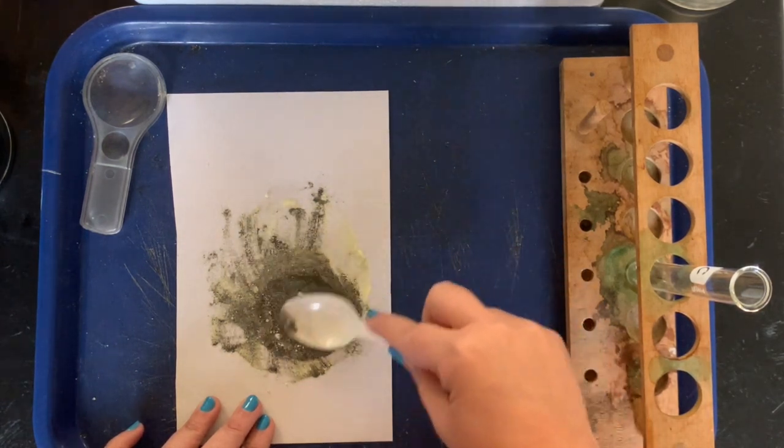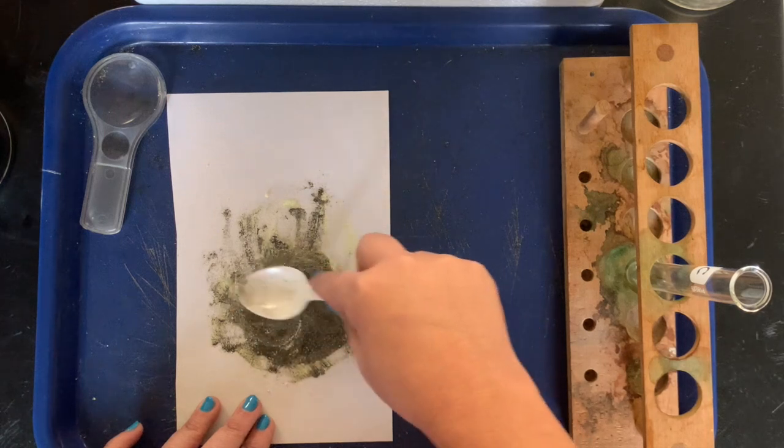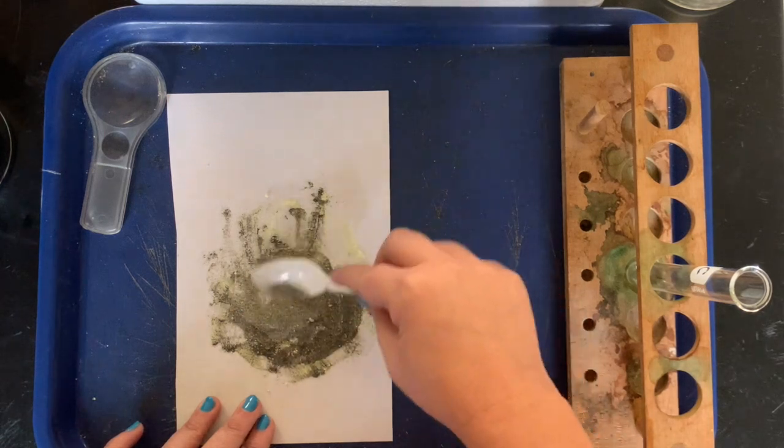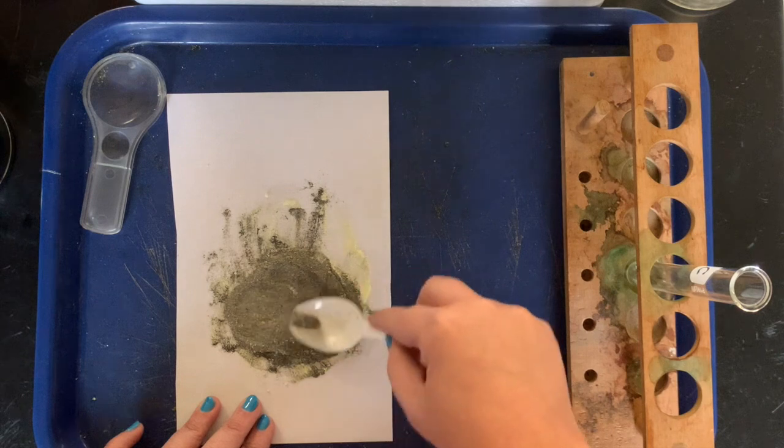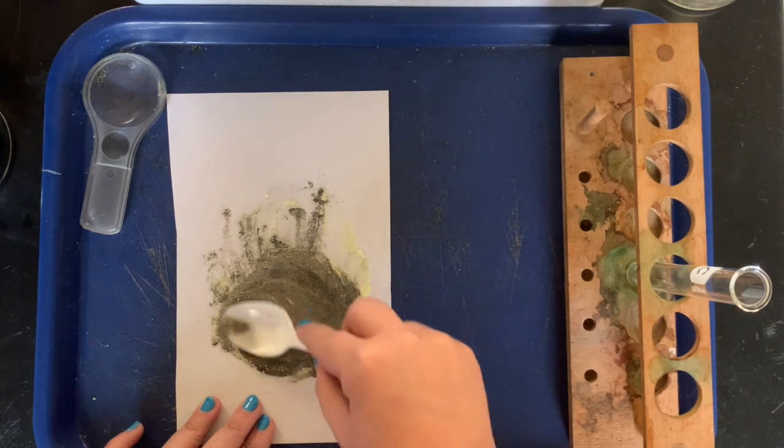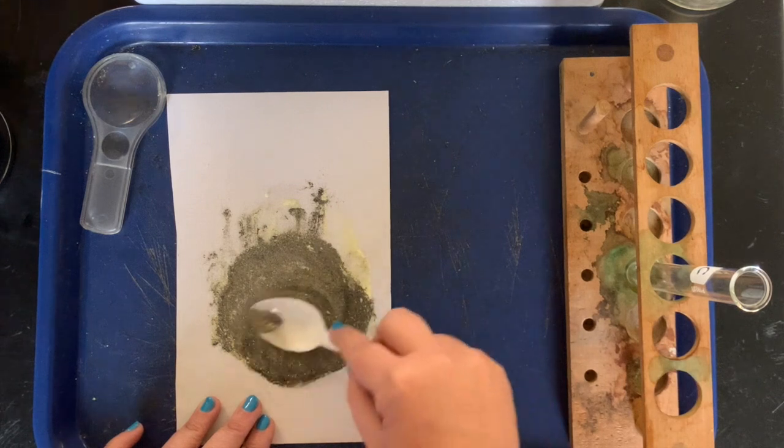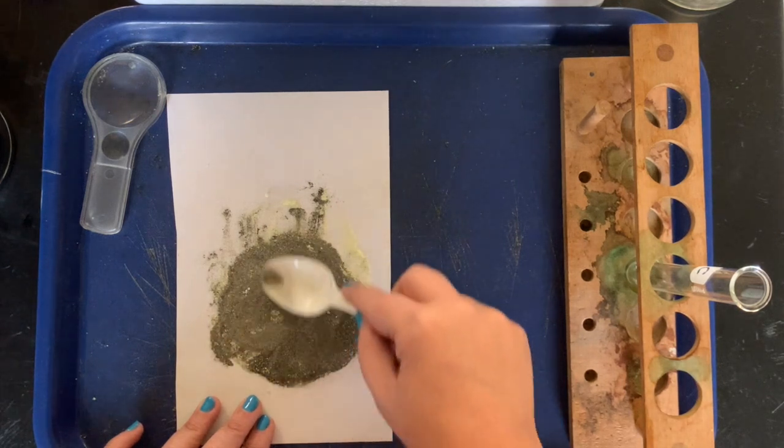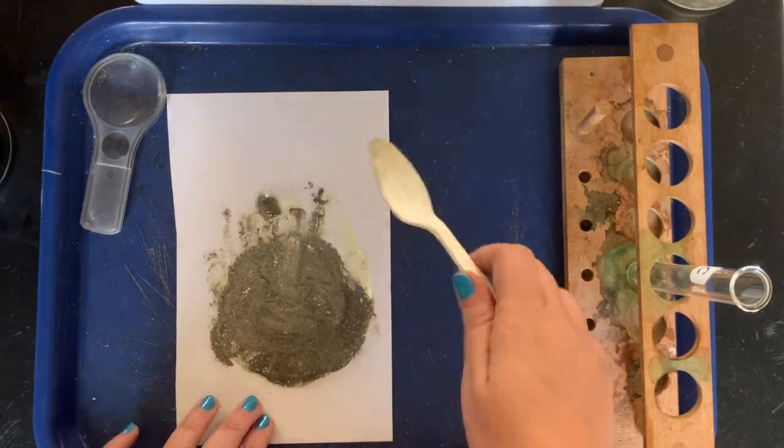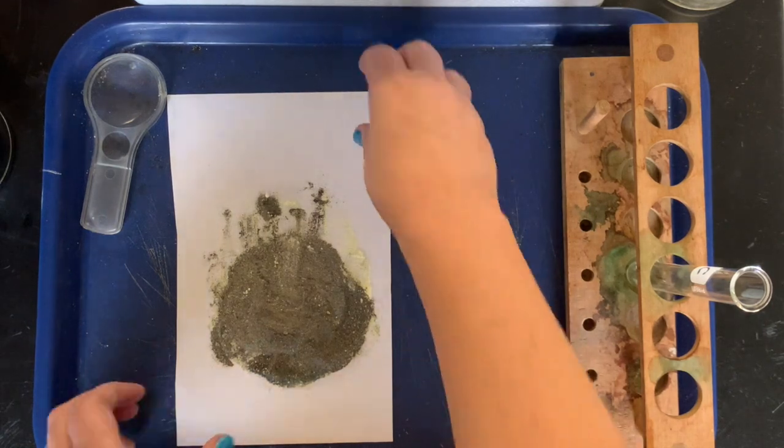Miss Hibbard, do you want to show them what you mean by separating iron from sulfur? I sure do. I was just trying to get it mixed a little bit better. Look at that, good mixture. It's so homogeneous. Good word, homogeneous. Can you spell that, students? And yes, Miss Gaffney and I know that we are cringy, we don't care.